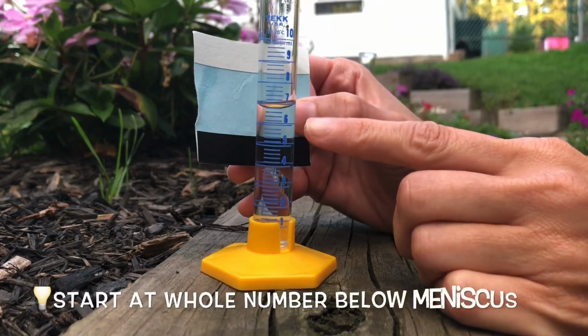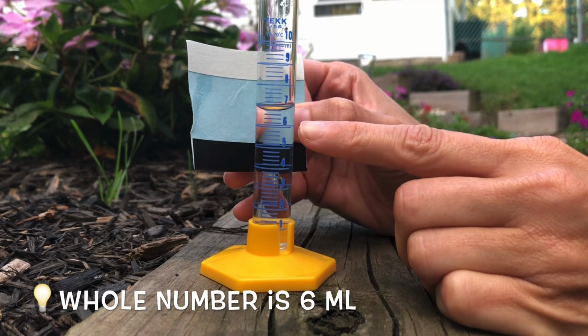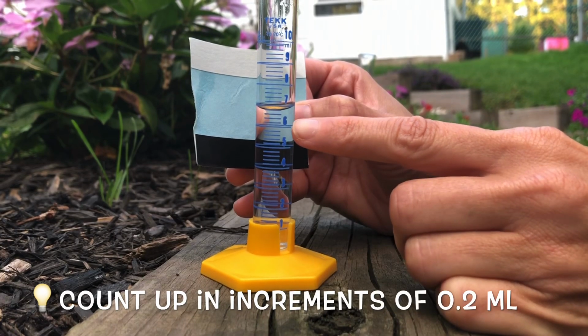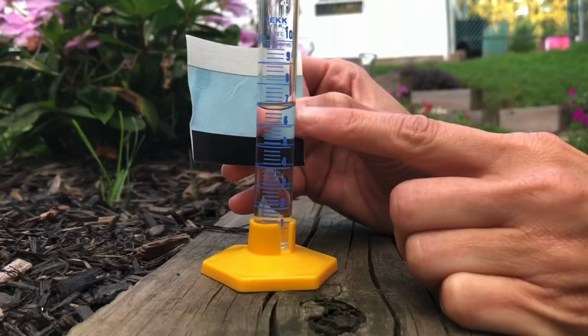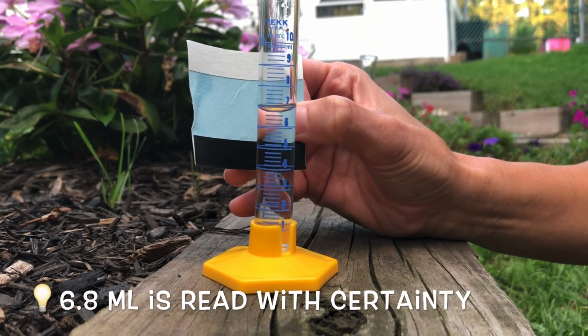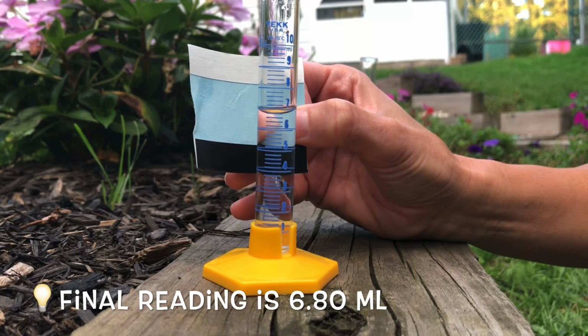Alright, you want to start at a whole number below the meniscus. In this case it's 6 milliliters. Now each small increment is 0.2 of a milliliter, so you count up: 6.2, 6.4, 6.6, 6.8. The bottom of the meniscus stops at 0.8, so my actual volume reading is 6.80 milliliters.